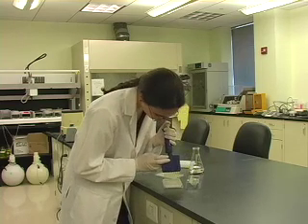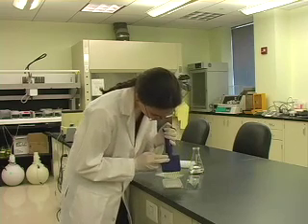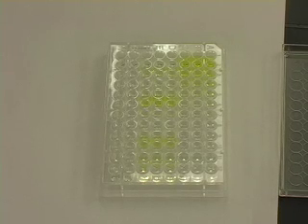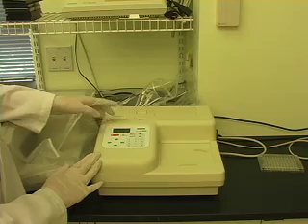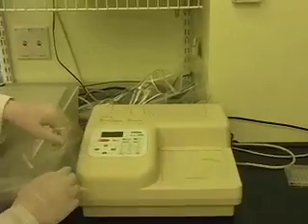After adding substrate, incubate the plate until color forms. After the plate has incubated according to the instructor's directions, read the plate with a spectrophotometer. Turn on the machine, place the plate inside, and set the machine to read at the instructor-specified wavelength. When you are finished reading the plate, print your results and take the plate out.